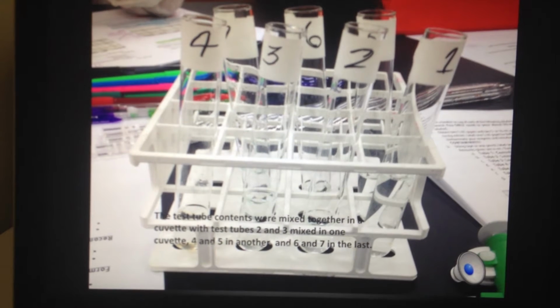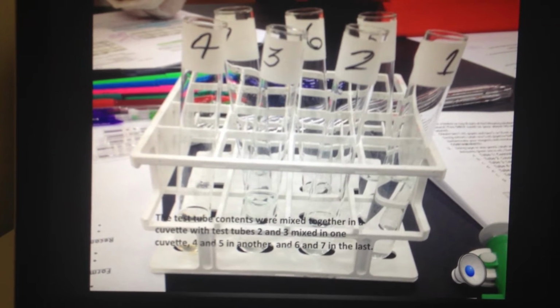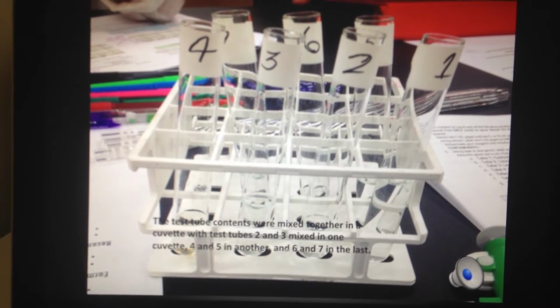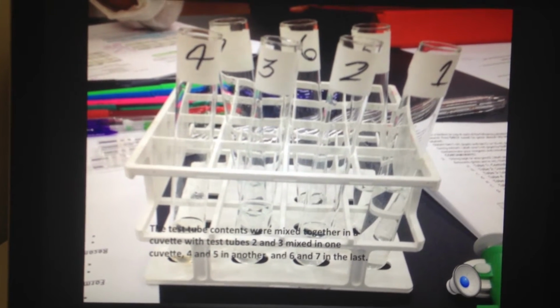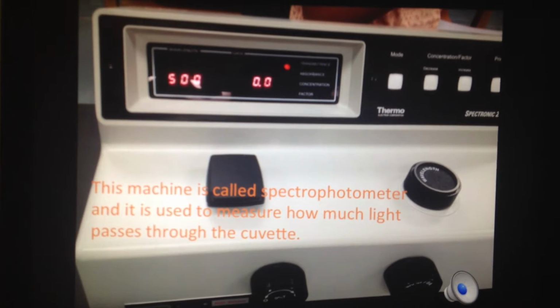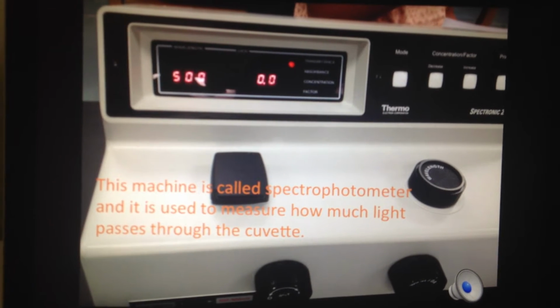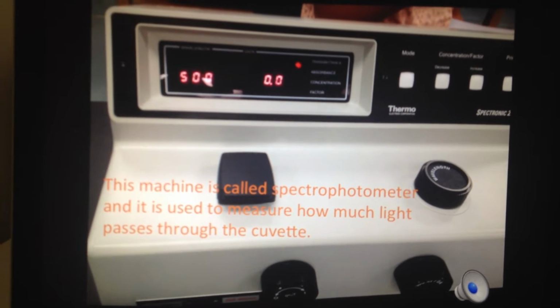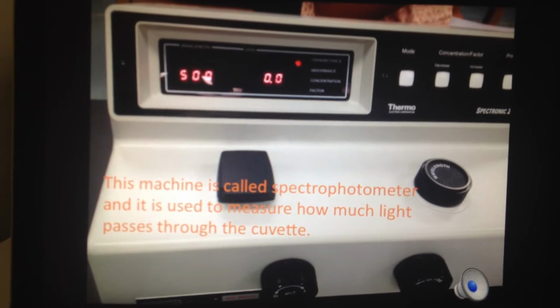The test tube contents were mixed together in the cuvette, with test tubes 2 and 3 mixed in one cuvette, 4 and 5 in another, and 6 and 7 in the last. This machine is called a spectrophotometer, and it is used to measure how much light passes through the cuvette. The cuvettes have a solution containing guaiacol and enzyme extract.